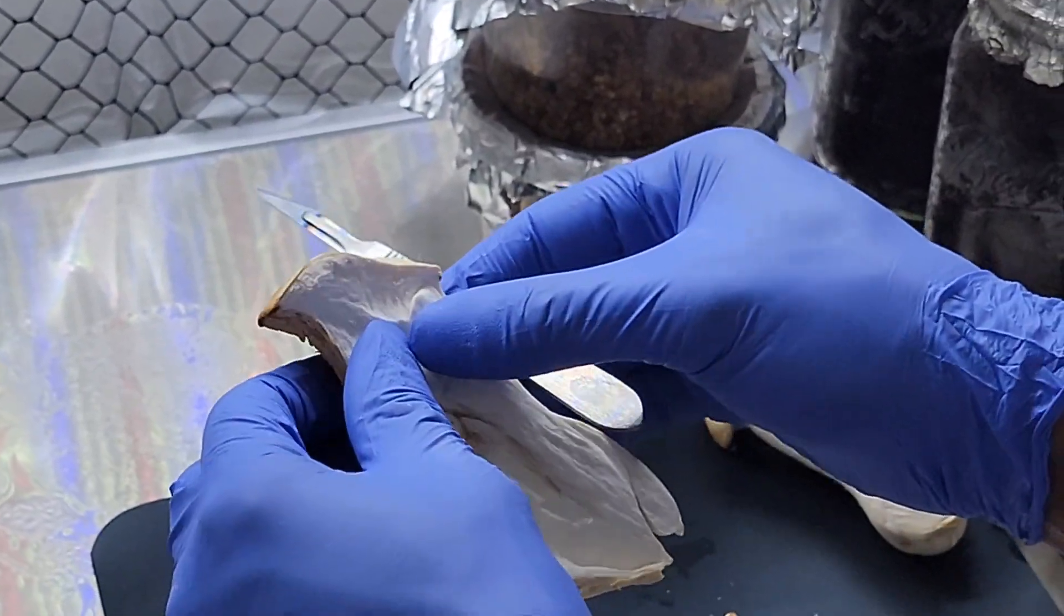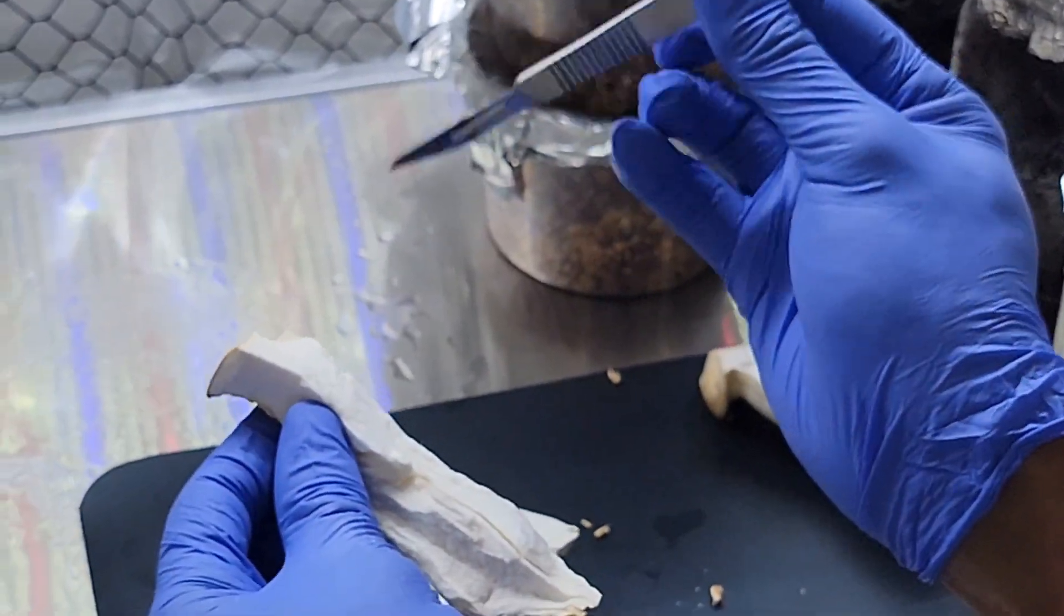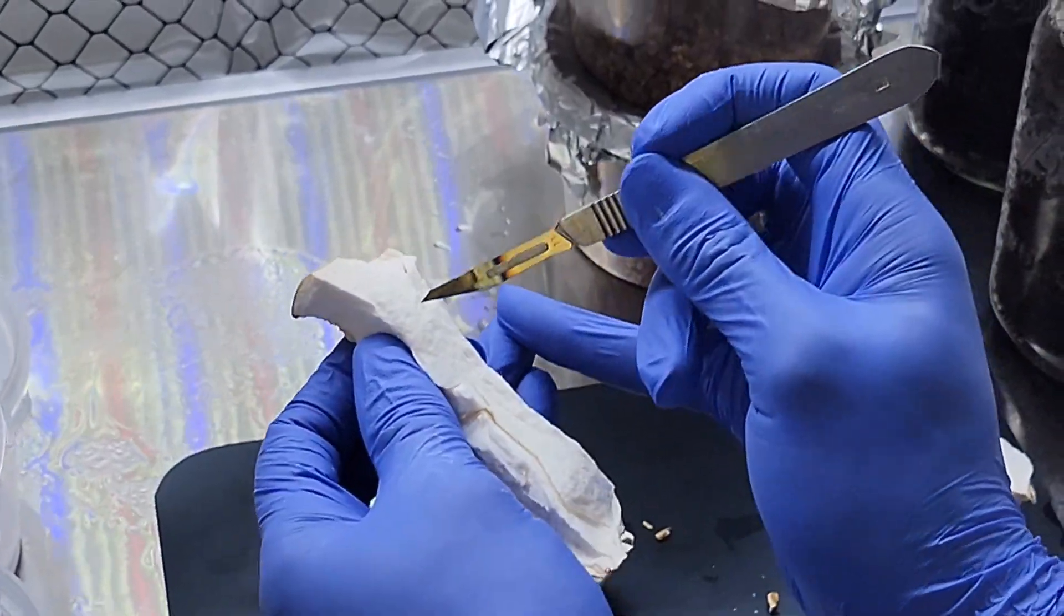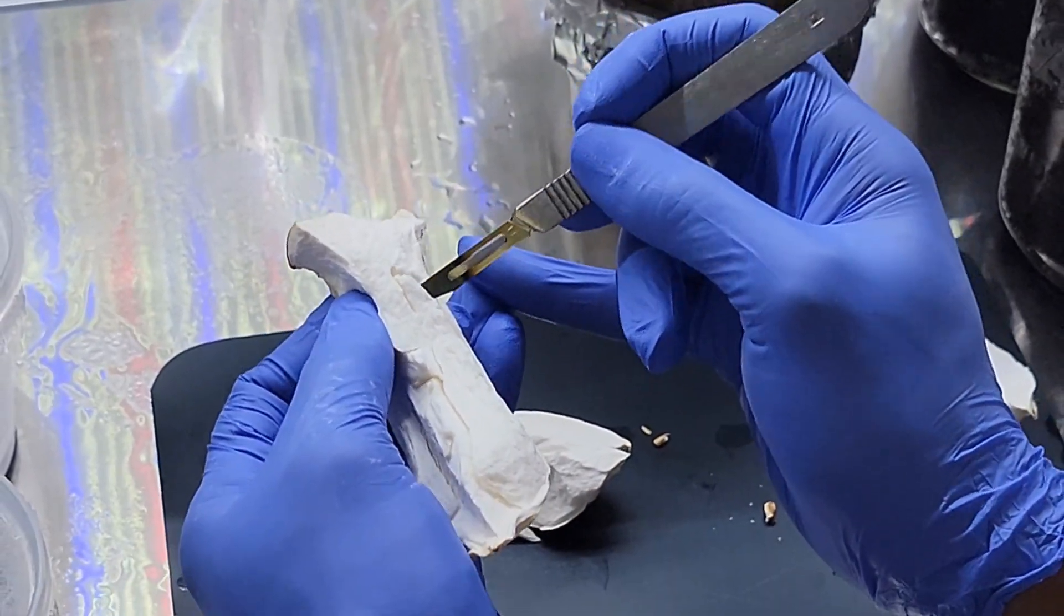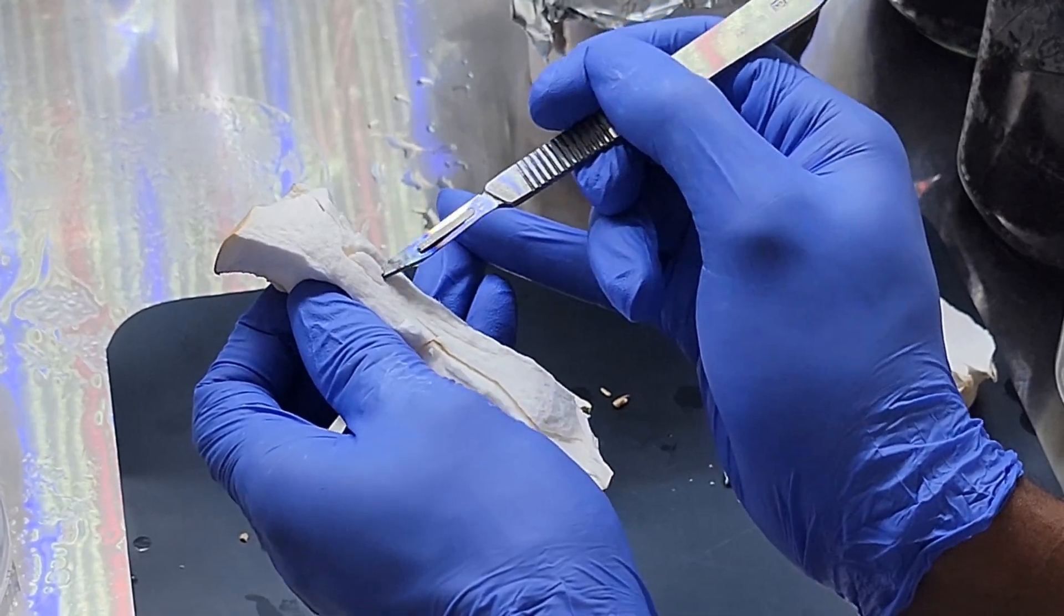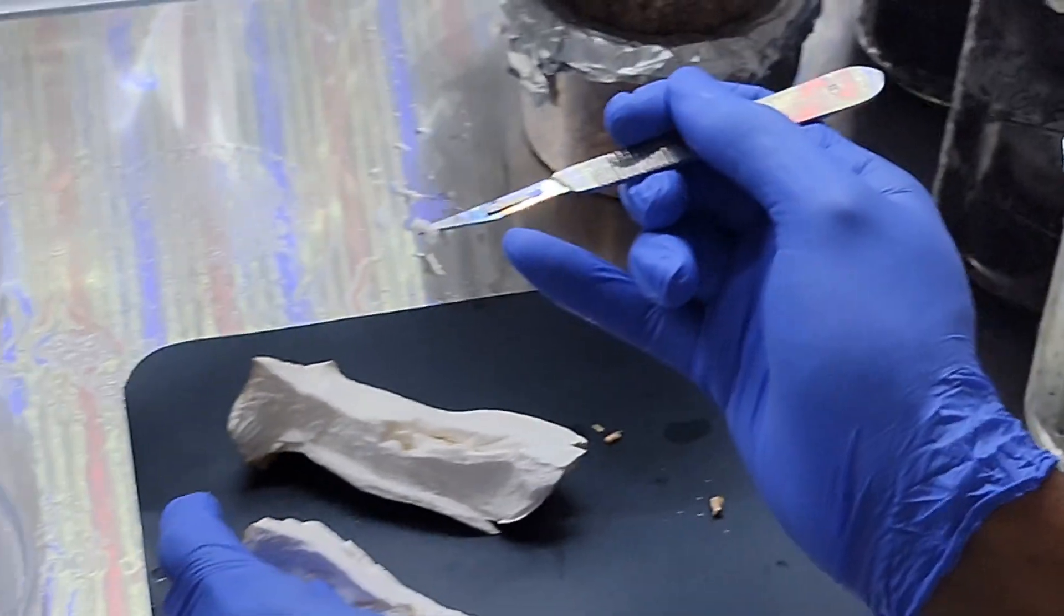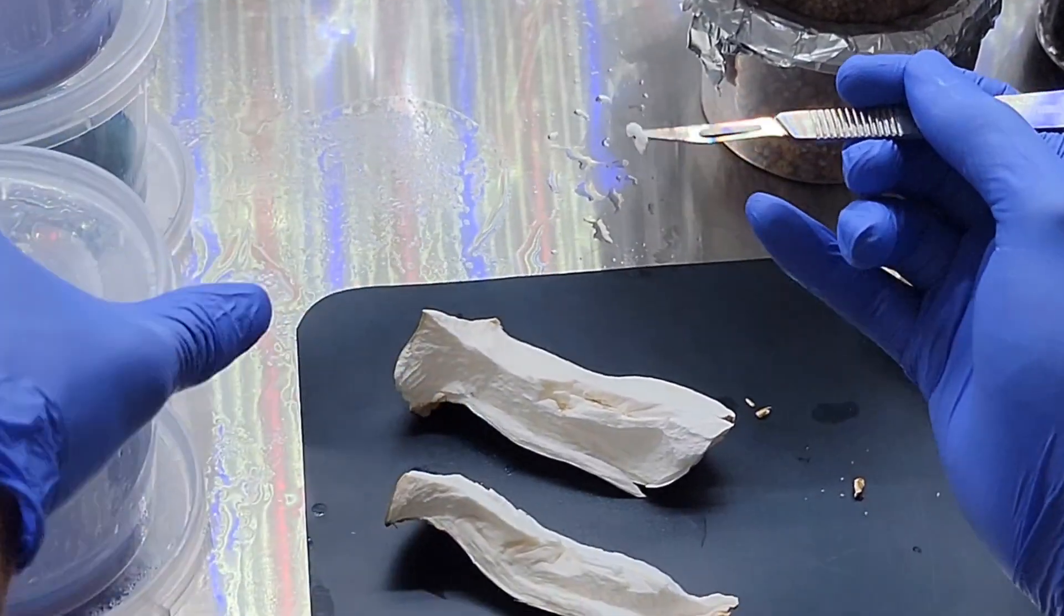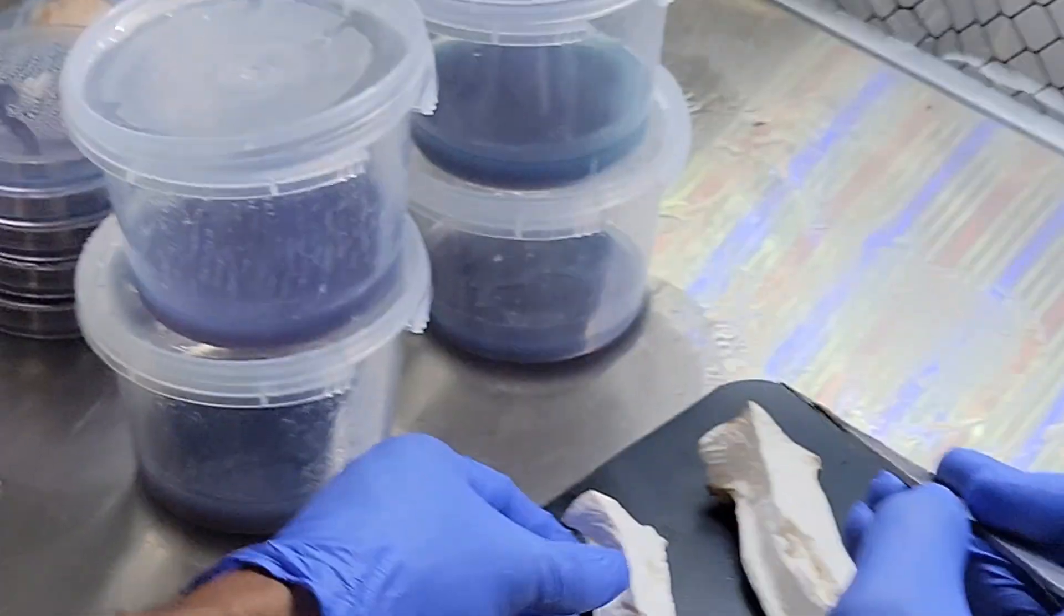And that will give us a broader understanding of how each step works. If you happen to have shaky hands or if you need a more precise cut, you can put your fingers together like I'm doing here - it'll make your cuts a lot more stable - and we'll just drop that sample right in there.